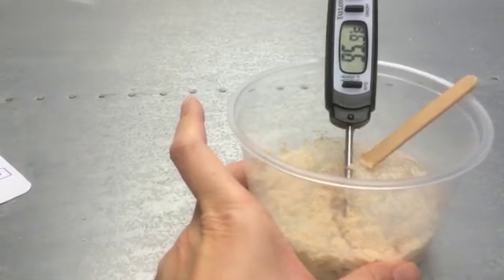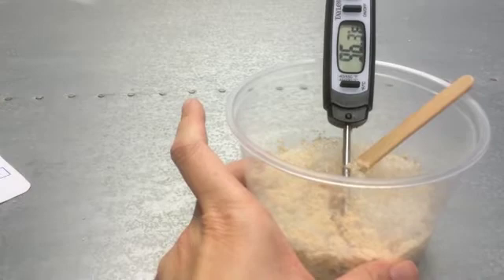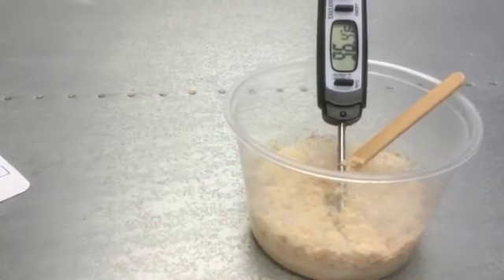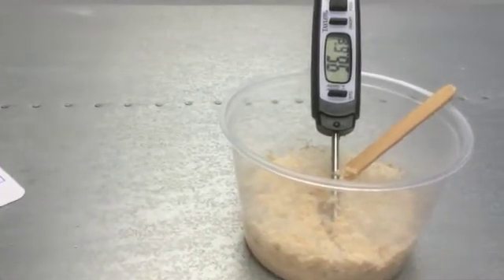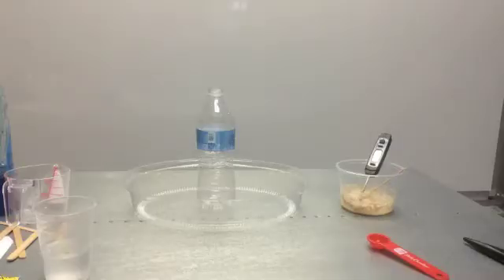Okay, so that's the first one. Let's see what happens with the second experiment. So the next chemical reaction that the students are going to perform is something called elephant toothpaste. That's kind of a classic activity for the classroom. Again, we're going to use hydrogen peroxide and yeast in this chemical reaction, and the students need to make observations, make predictions, and also look for signs that a chemical reaction is occurring.